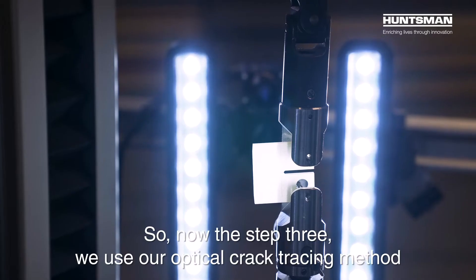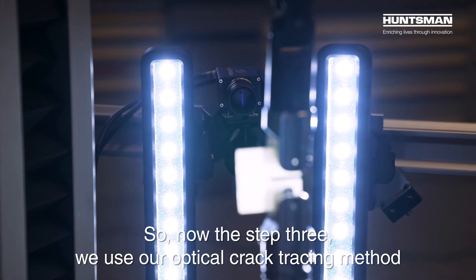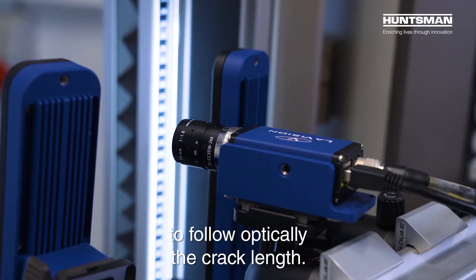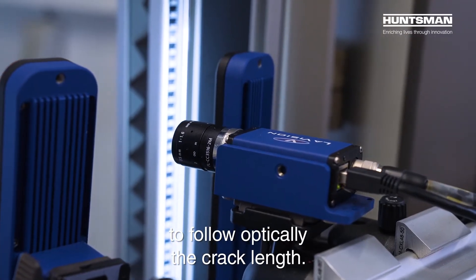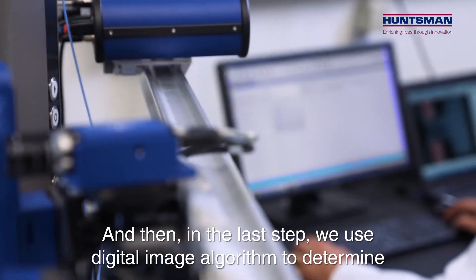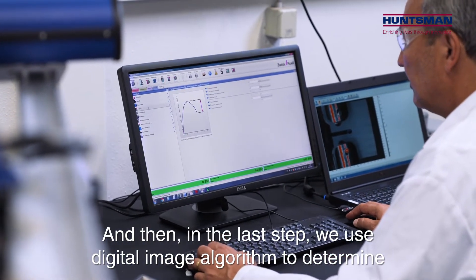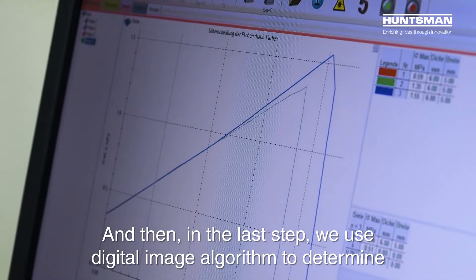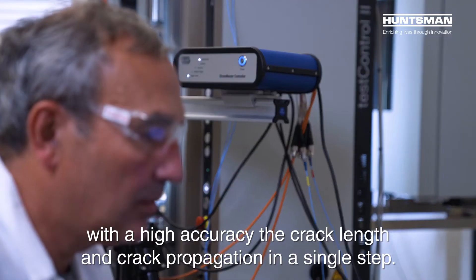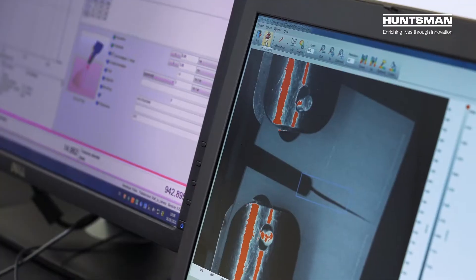In step three, we use our optical crack tracing method to follow optically the crack length, and then in the last step we use a digital image algorithm to determine with high accuracy the crack length and crack propagation in a single step.